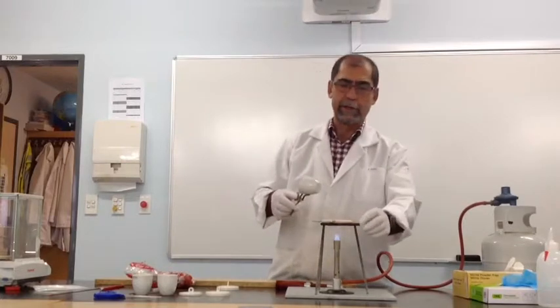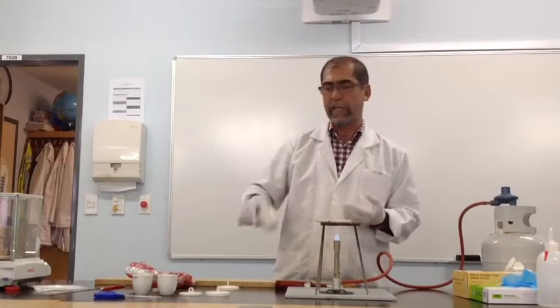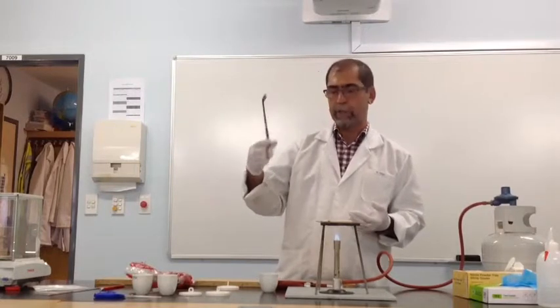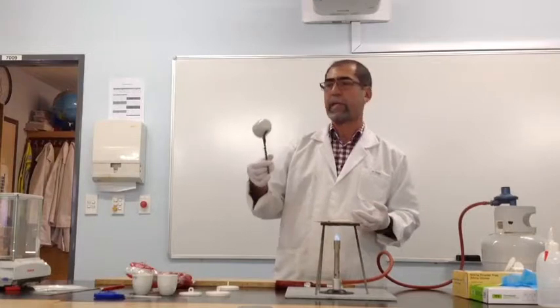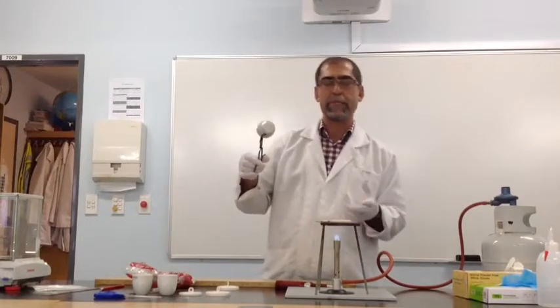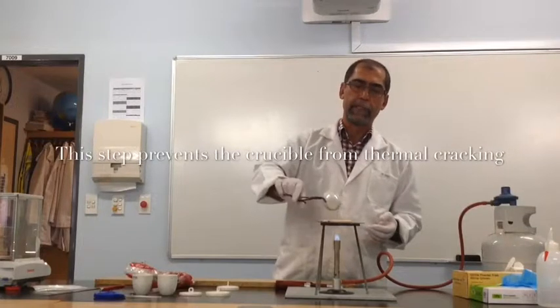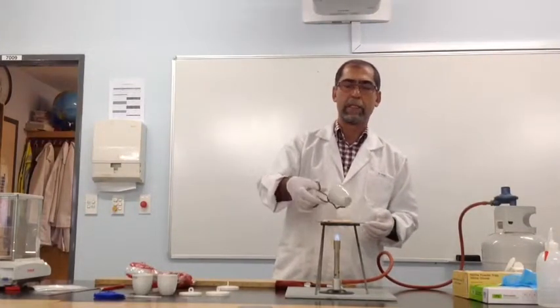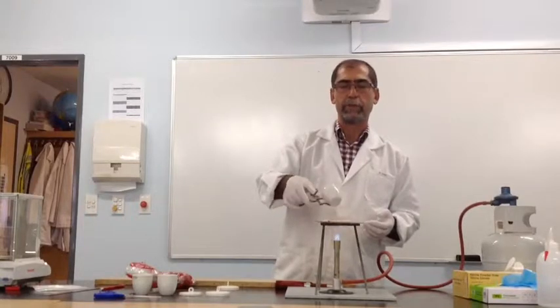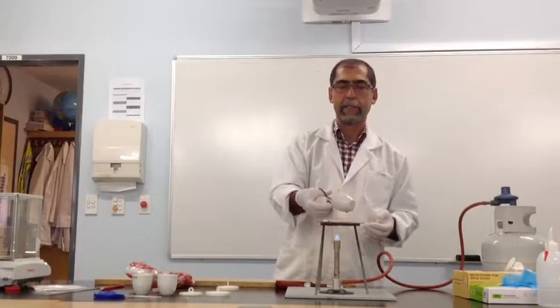Putting it immediately on a very hot flame can cause the crucible to crack. So I suggest you use the tongs, hold it somewhere very strong so it's not flimsy, and then gently run it over the flame so the crucible warms up slowly before you lower it to burn it for approximately 2 minutes to ensure all the organic matter is burnt off.